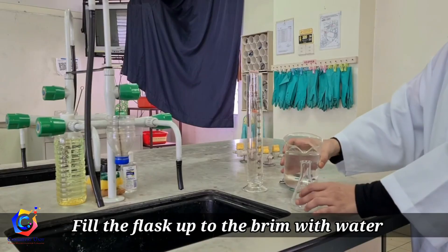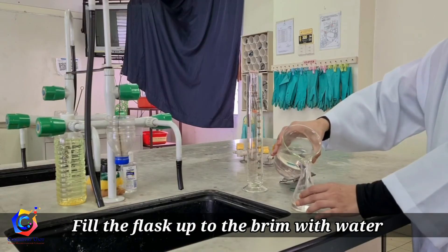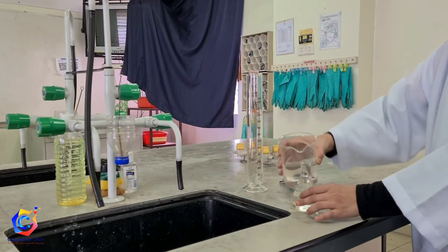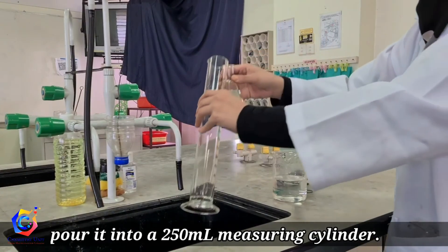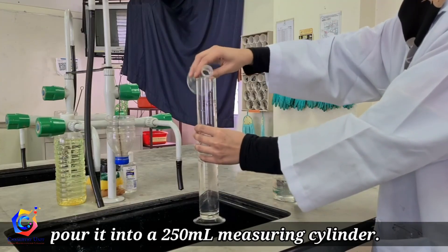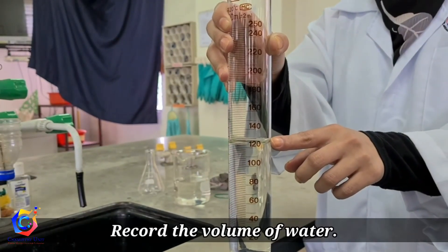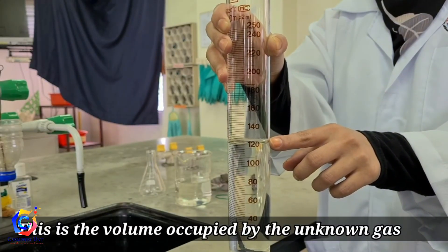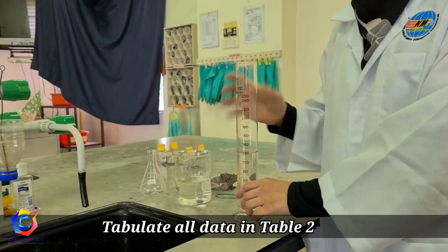Fill the flask up to the brim with water. Pour it into a 250 ml measuring cylinder. Record the volume of water. This is also the volume occupied by the unknown gas. Tabulate your data in Table 2.